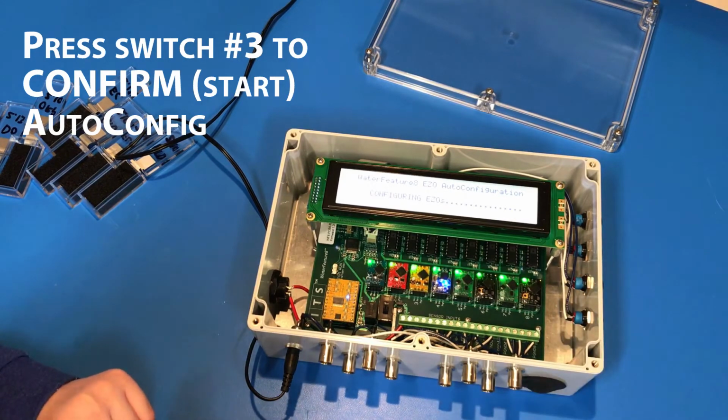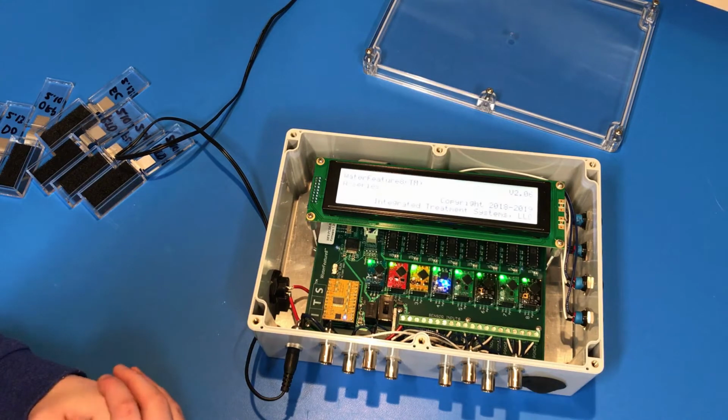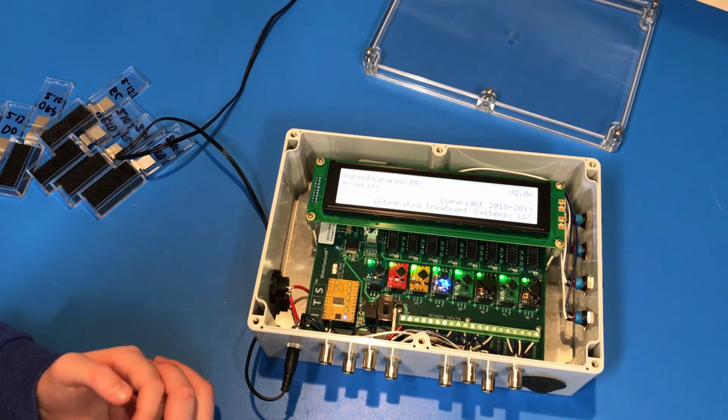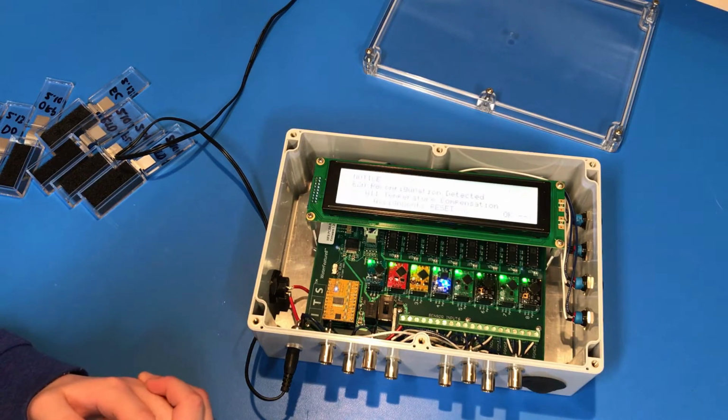Very quickly it rewrites some settings into the EZO circuits that are installed. It says complete. It will reboot. And when it's done booting, it'll take us to the home screen and it will start polling. AutoConfigure is literally that simple.